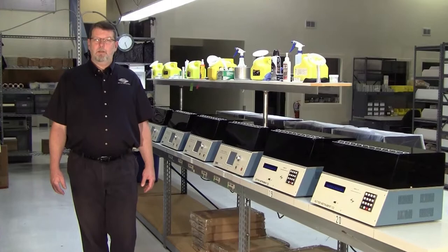A pull cable that has detached or is not properly adjusted is one of the factors that may cause variability in your pull results. So our tech support will ask you to check the adjustment of the pull cable and probably a few other components.